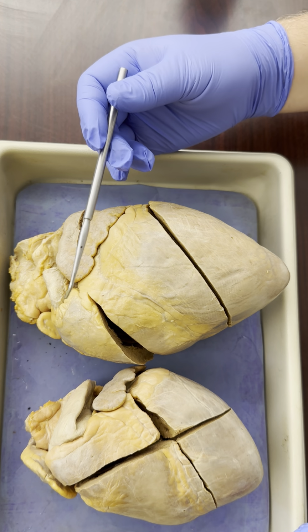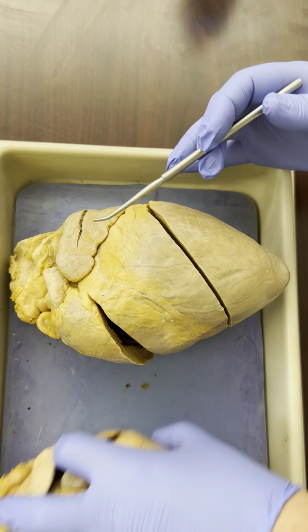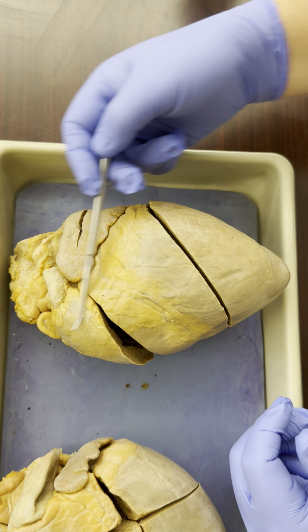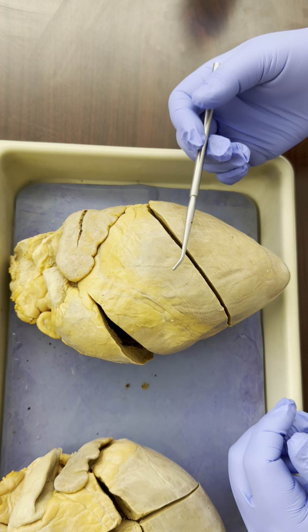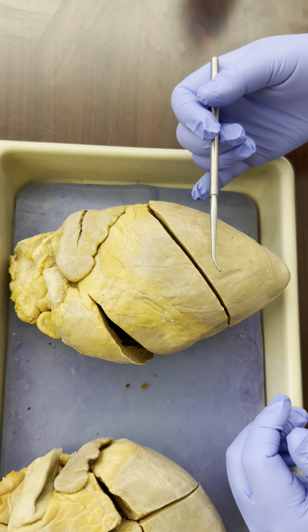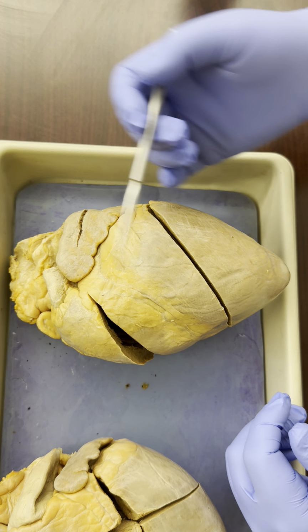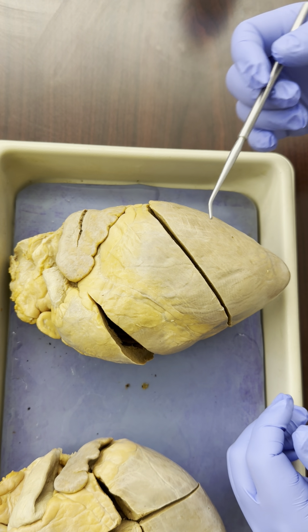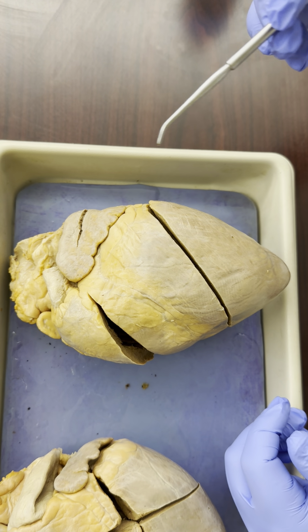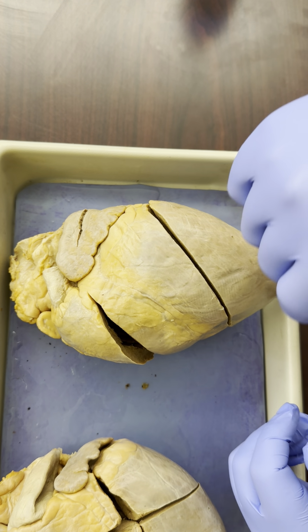Well, first of all, you have to be able to determine which part of the heart you're looking at. I told you that this was the anterior surface, but you will not be told that on an exam or a quiz or something like that. So how do you know what is the anterior side, posterior side, superior, inferior, whatever? Well, there's a few landmarks, and one of them is this point down here on one part of the heart.